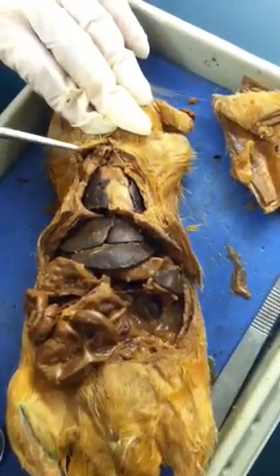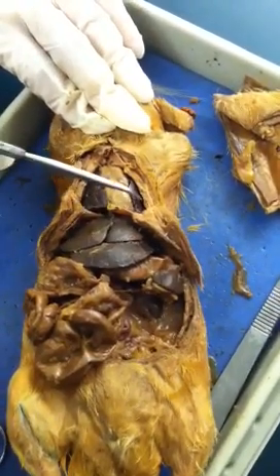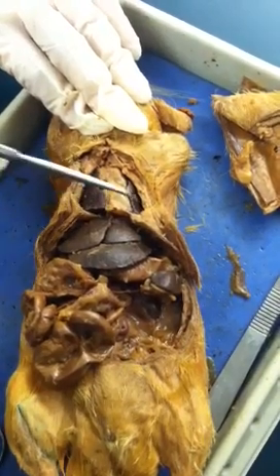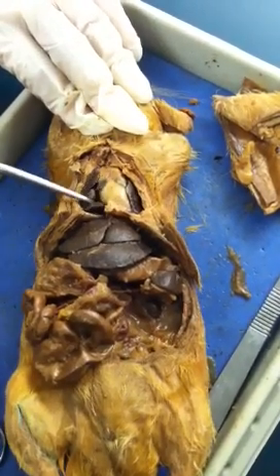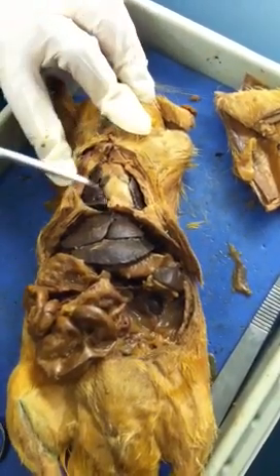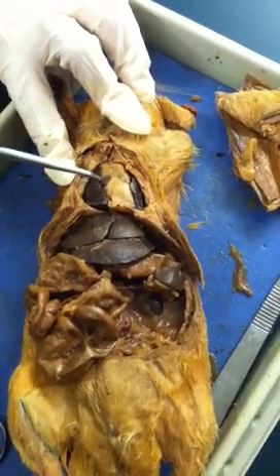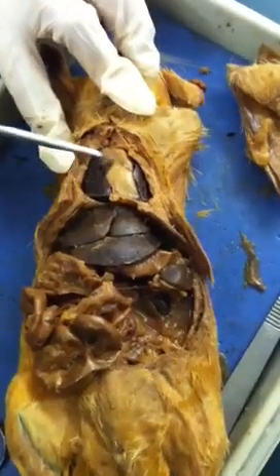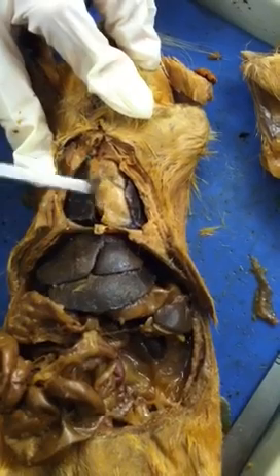If you start in the thoracic region, you will see lungs — one on each side — and the heart. For the heart, it's just like the human heart. They have four chambers: two atria and two ventricles.